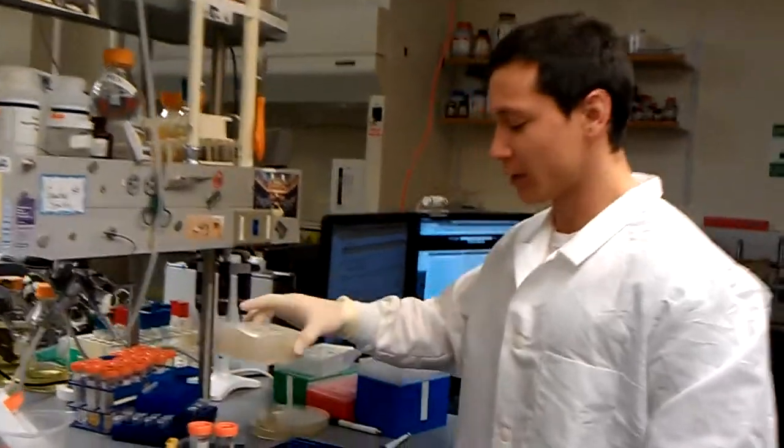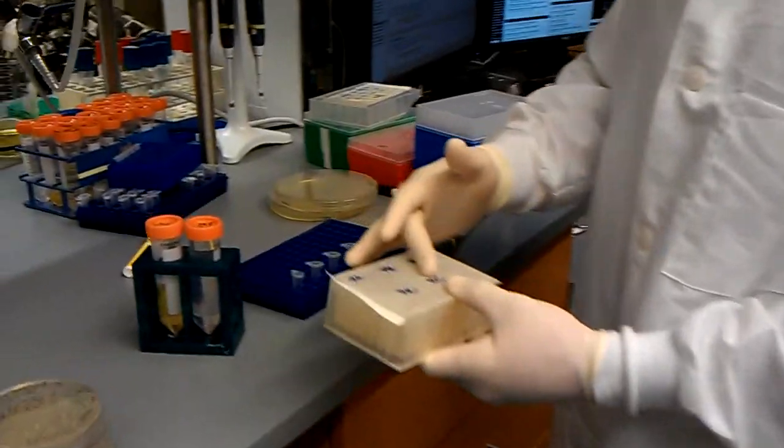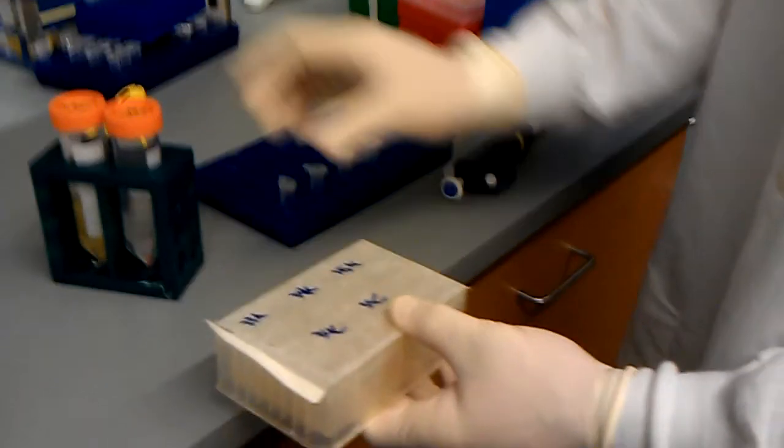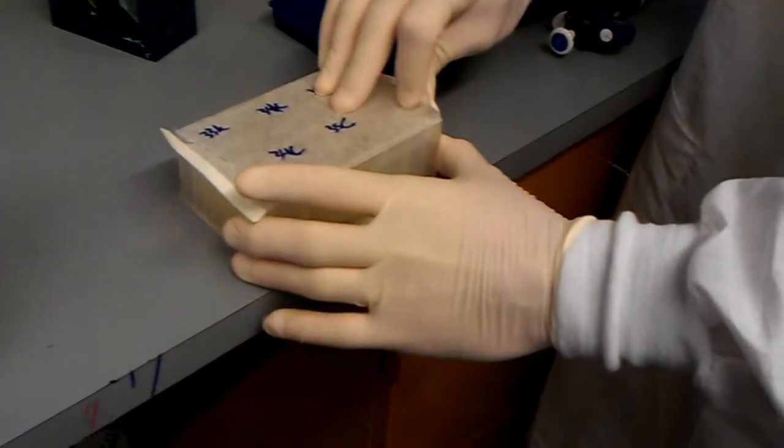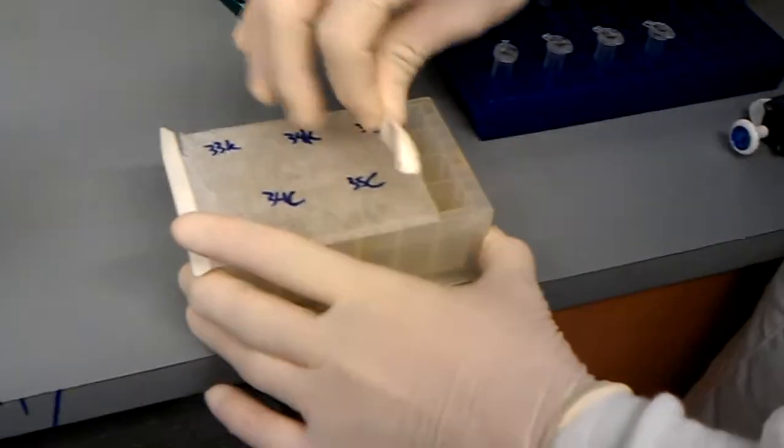So I'm going to start off with my overnight culture. I have five samples. Unfortunately only four of them grew up. So if I open these up, you always want to make sure you keep track of what's what.